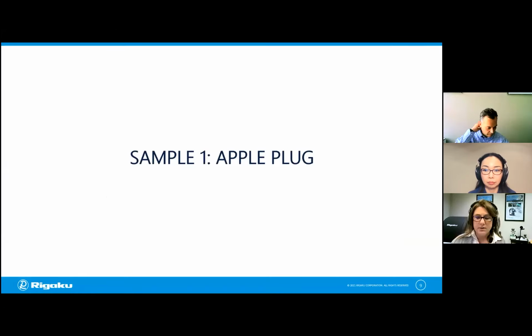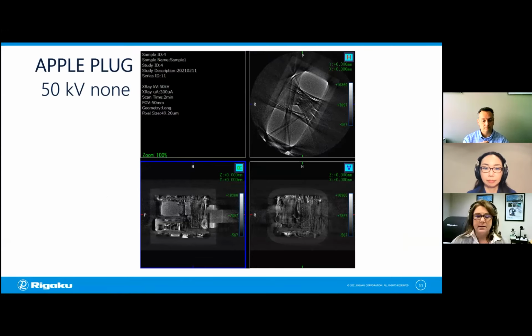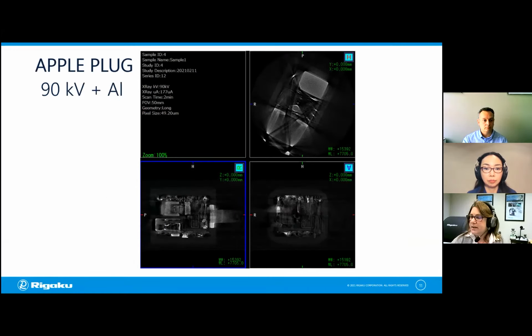So just confirming, you can see the other screen now, and we see the slide. Yes. So if in fact we had measured data using 50 kV and no filter, you can see how terrible it really is. There's much more of the metal artifacts coming through. If you use an aluminum filter, it's a tad better. However, with the copper filter, it's even better. So that's the right condition. And in fact, we might try a number of different filters or settings for our final image.